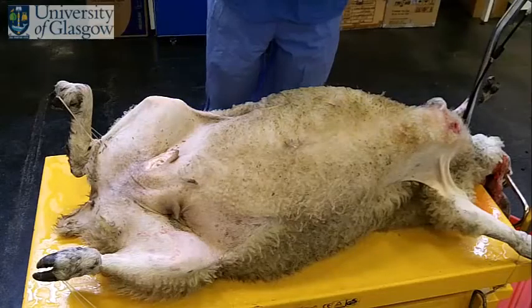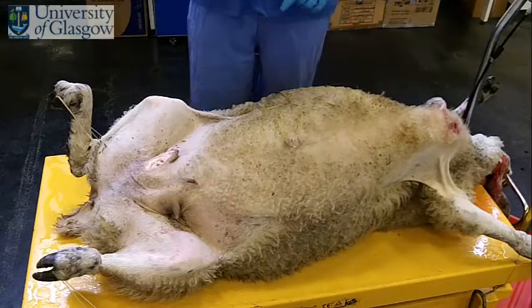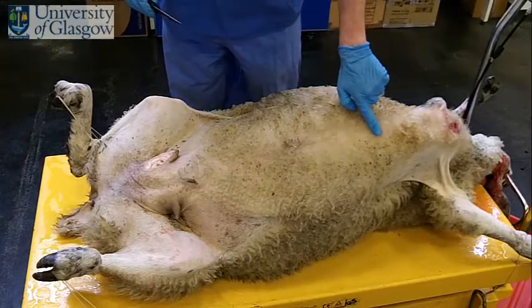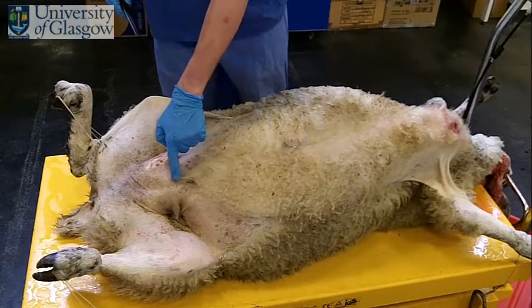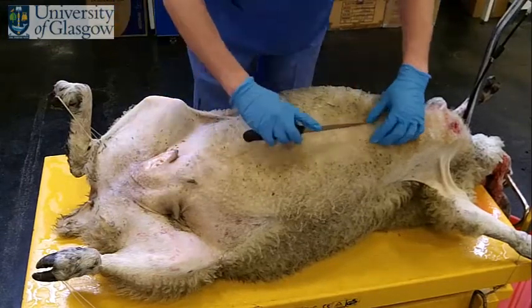We're now going to open the abdominal cavity of the sheep. We're going to make a ventral midline incision, starting caudal to the sternum, along the line of the linea alba, down towards the pubis.